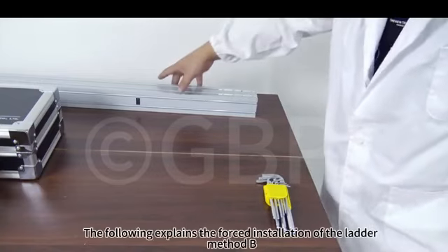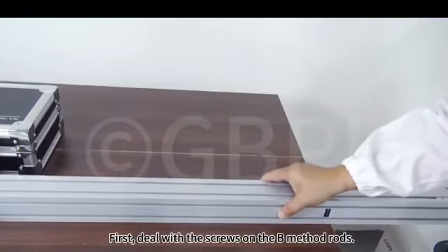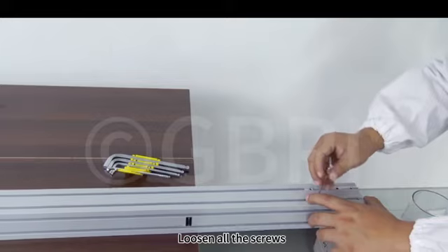The following explains the installation of the ladder method B. First, deal with the screws on the B method rods. Take out the appropriate hex screwdriver. Loosen all the screws.